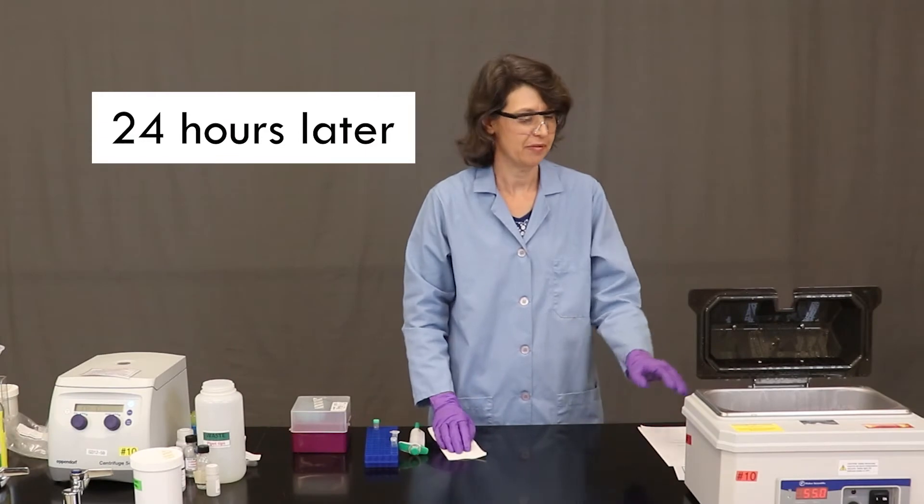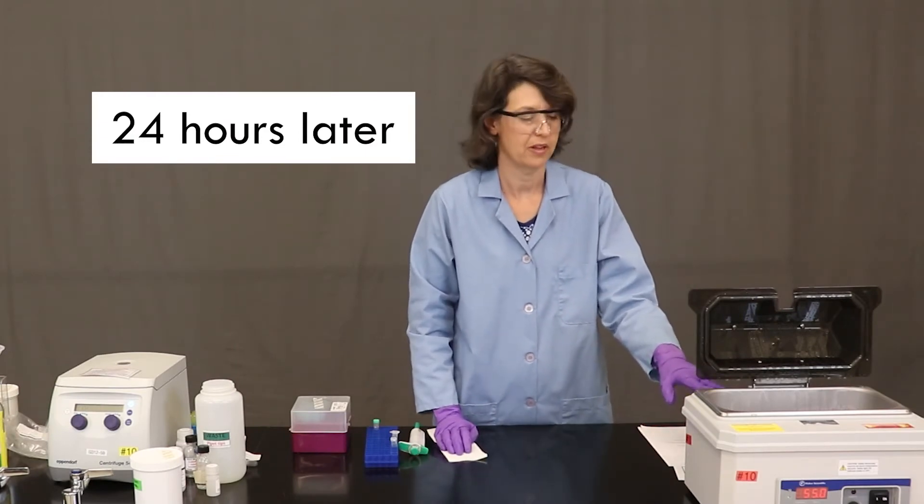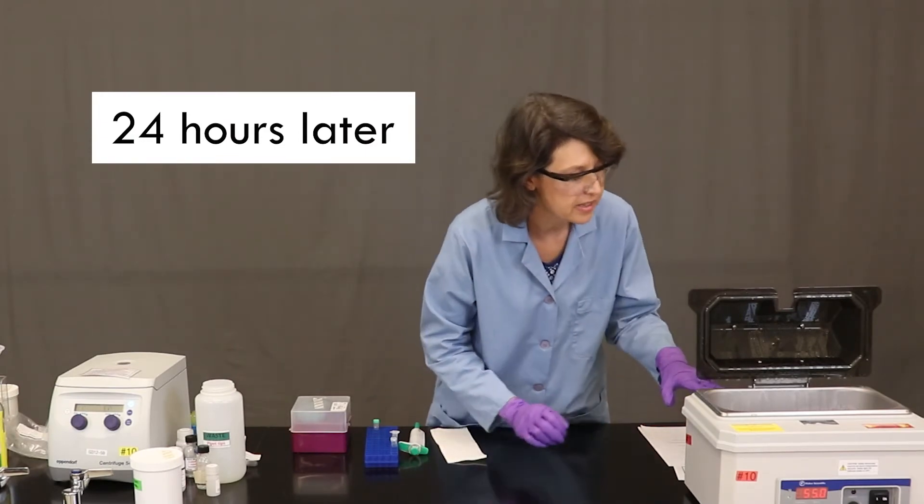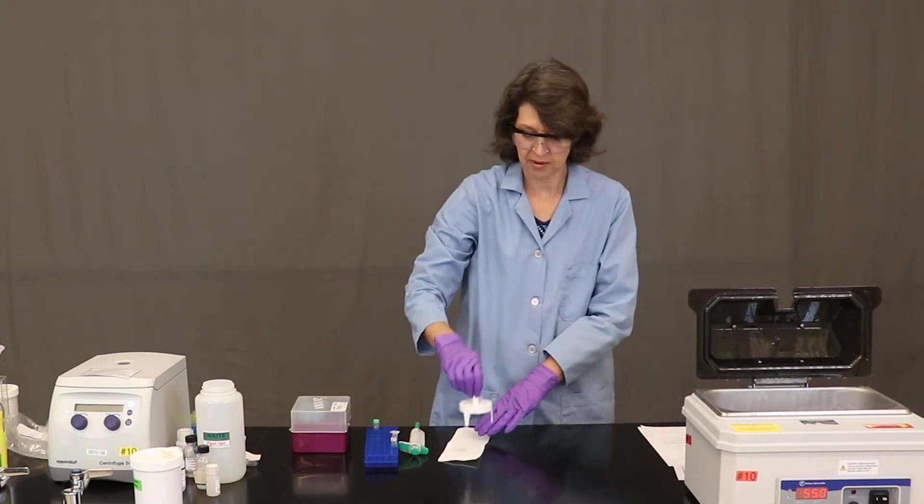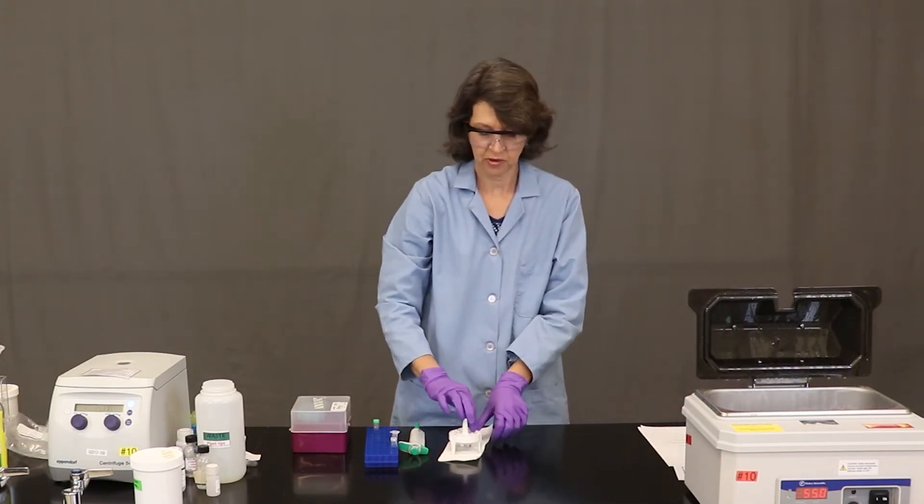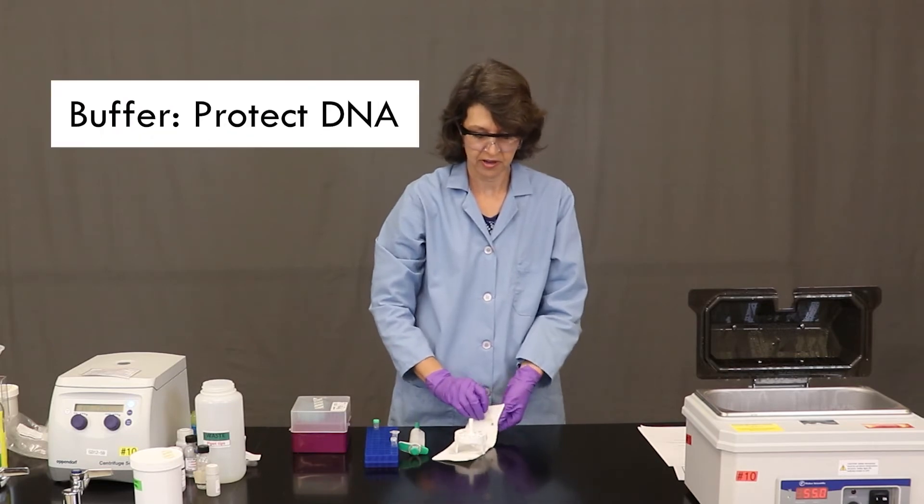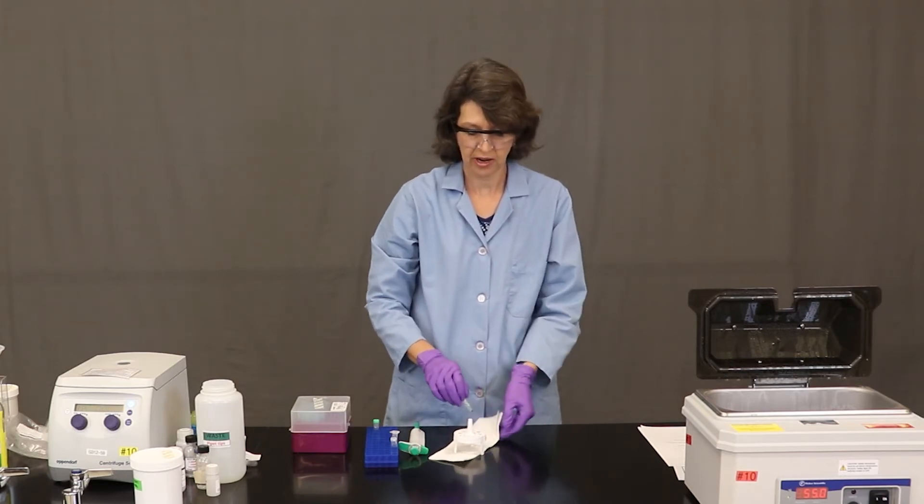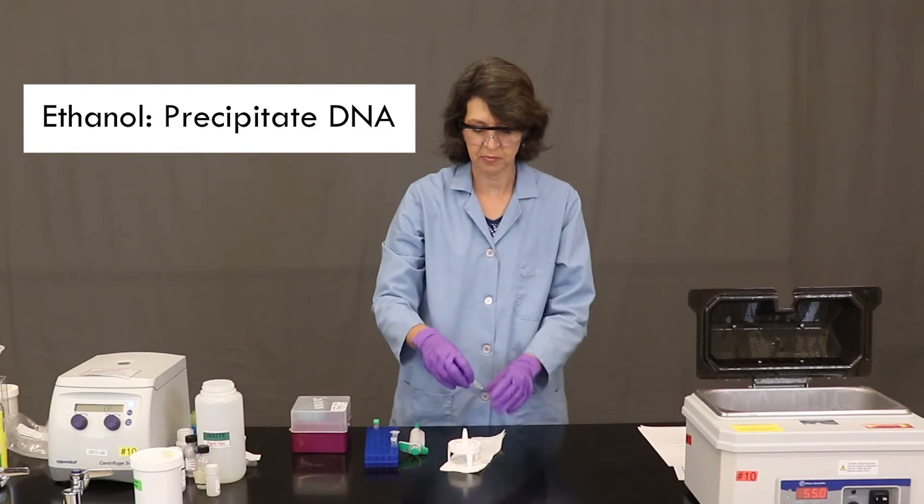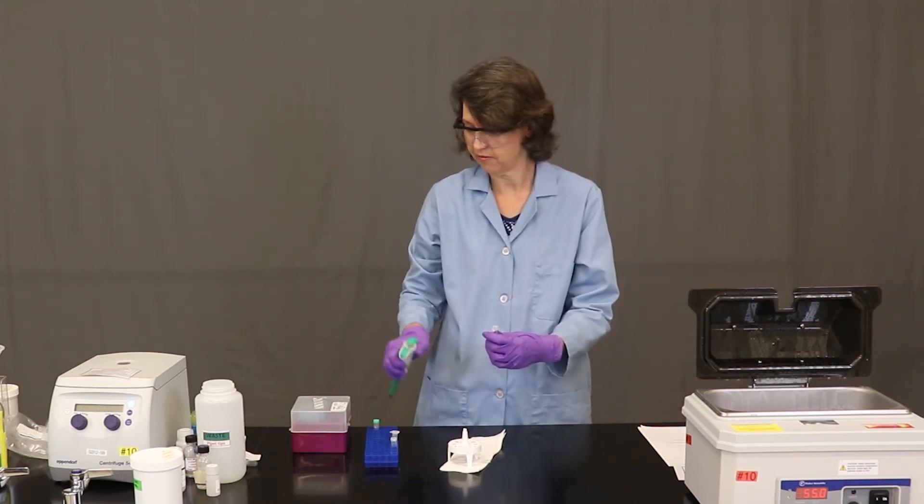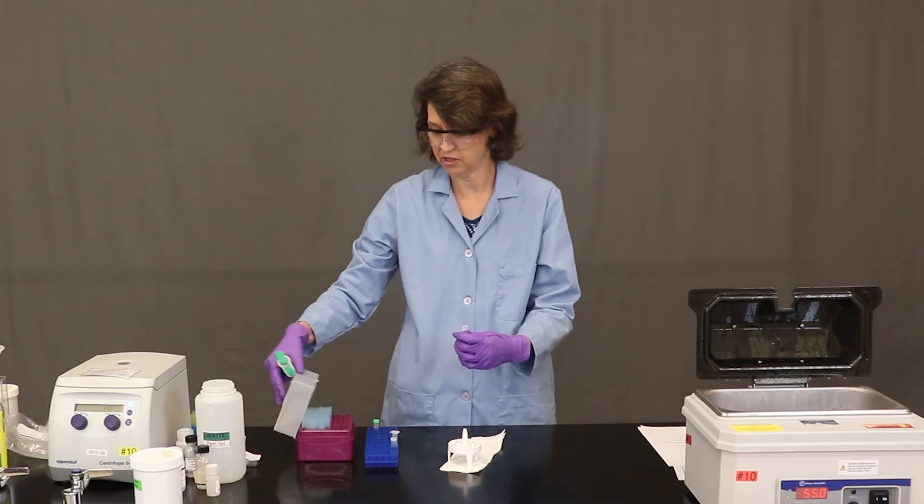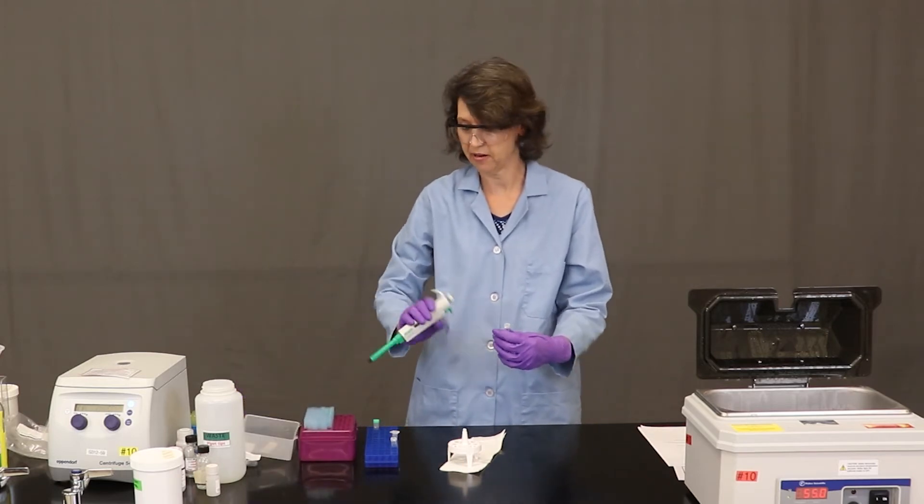Now that our DNA sample has been sitting overnight in the water bath, we'll go ahead and take it out. And the first step that we're going to do is we're going to add some buffer to protect the DNA. And then we're going to add some ethanol, which will precipitate the DNA.